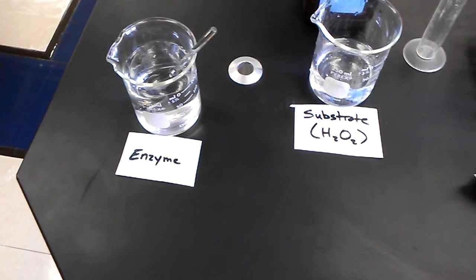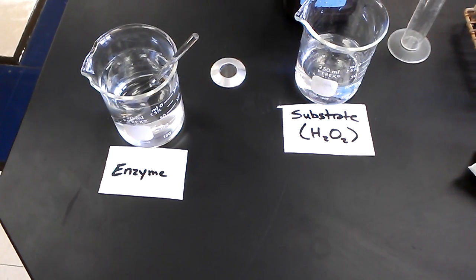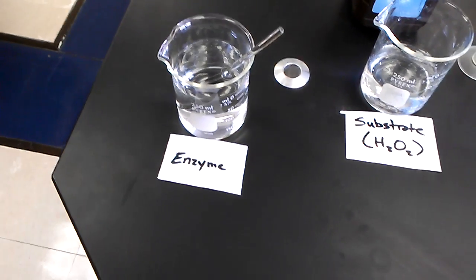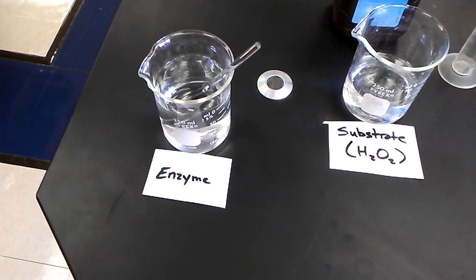This video will instruct you on how to go about setting up your enzyme catalysis experiment. In the beaker on the left is our enzyme, which is catalase.